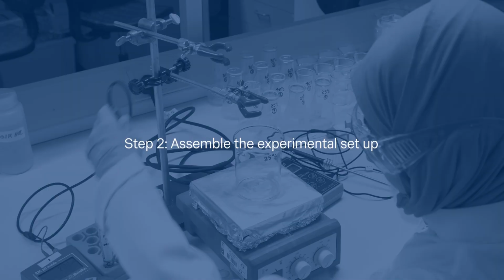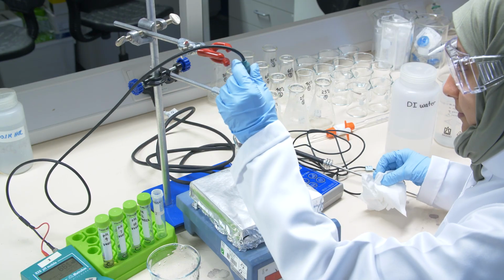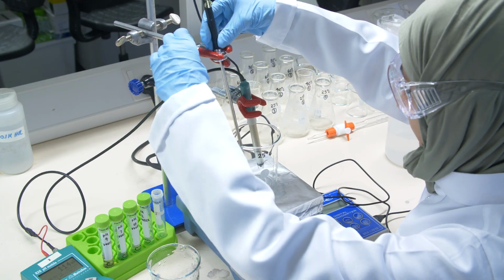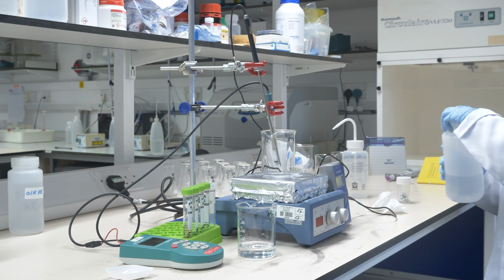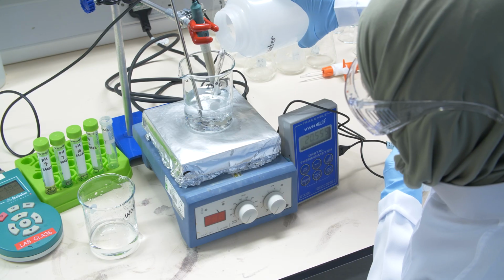Now in step 2 we are setting up the experiment. For that we use the magnetic stirrer. We put the vessel on it, then we add the pH electrode, fix it, and we take the thermometer, so that we know the temperature. Now in step 3 we are conducting the experiment. So here we see the setup which we just prepared, and the first thing is that we add the water where we dissolve the calcium hydroxide.